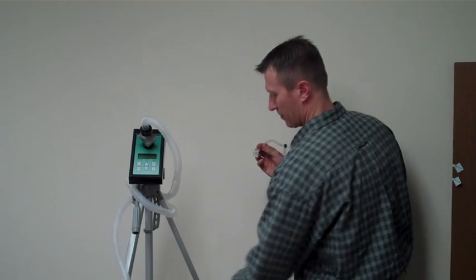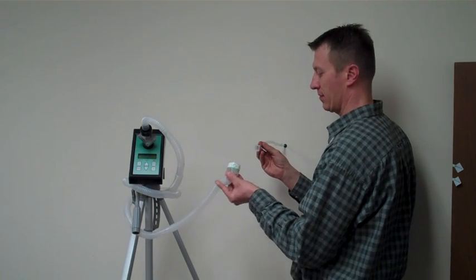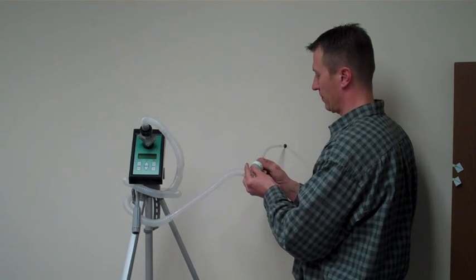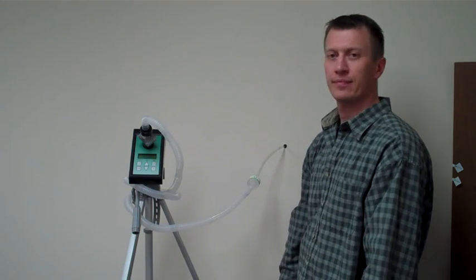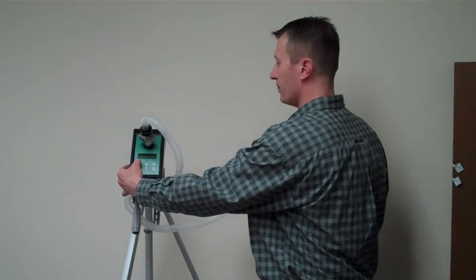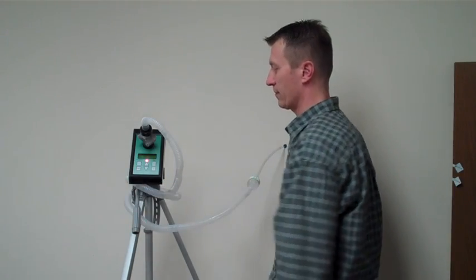Then he will connect the aerosol spore trap to the tube, which is in turn already connected to the air pump. Now he will turn the pump on and the sample collection will begin.